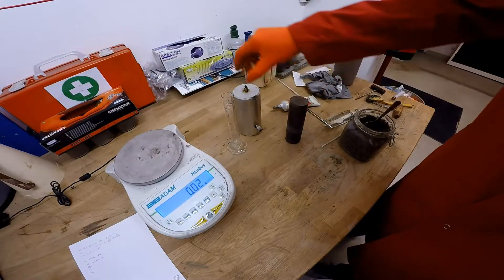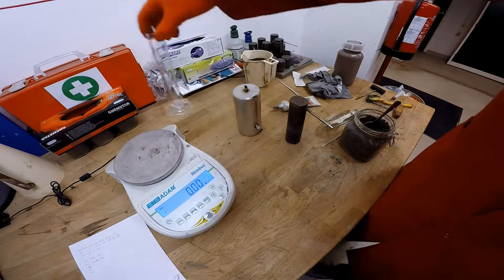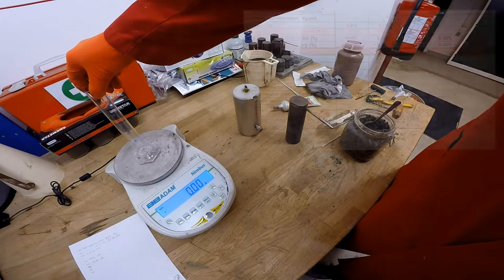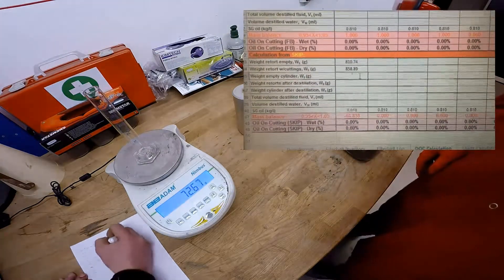Now remove that and take a weight of the cylinder empty. Add the figures into the computer or the bit of paper.